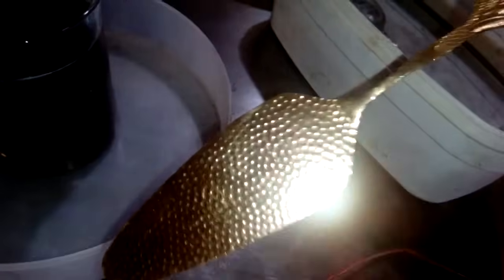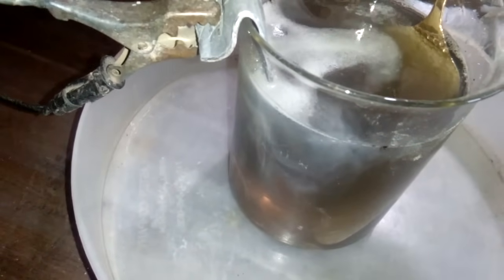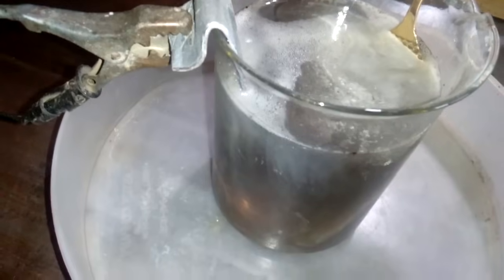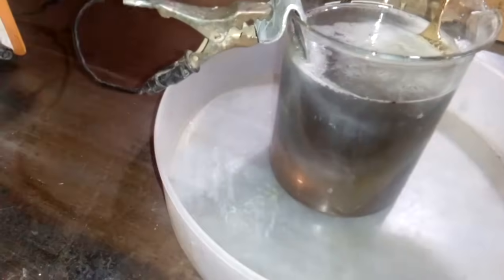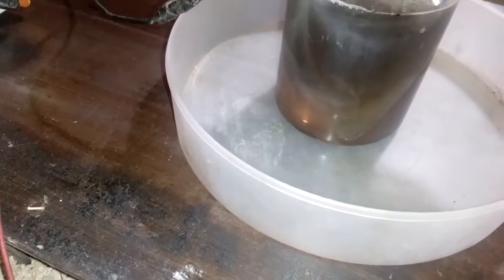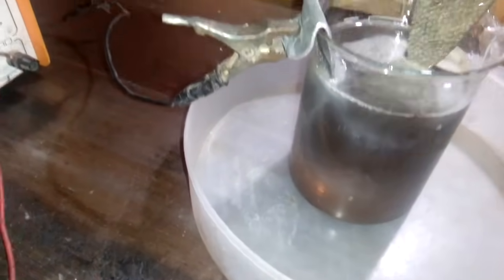Now the next item is this stuff - but this is not stainless steel, I think it's a copper plate. Whoa, you see that reaction? Very nice. And it's already done, see that? Very, very nice.